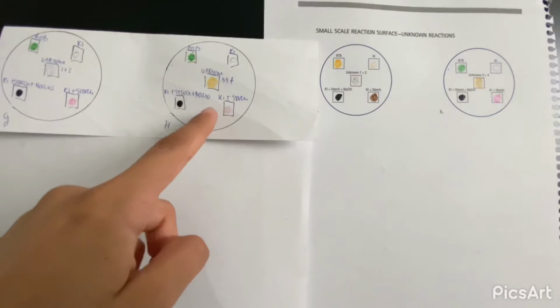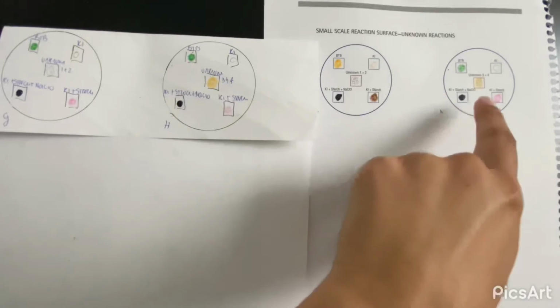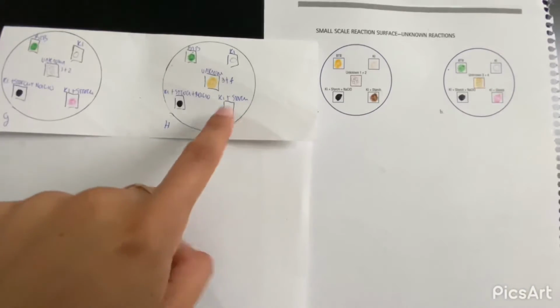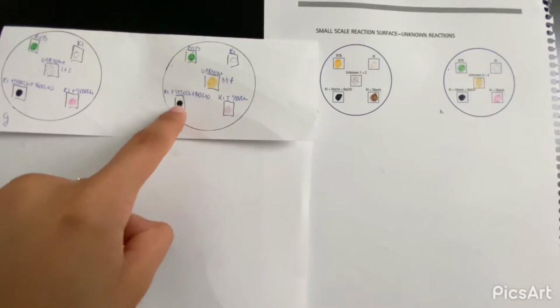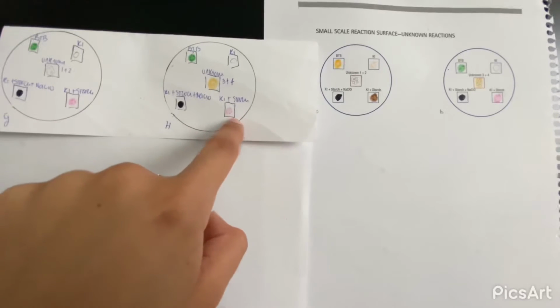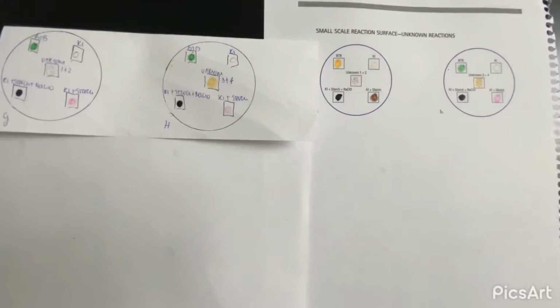For the other unknown H, we start having this yellow brown color. We'll still have the same color, but we can see bubbles after. Before, our BTB stays the same, our KI stays the same. KI starch and the NaClO, same color, and KI and starch ended up being a little strong pink.